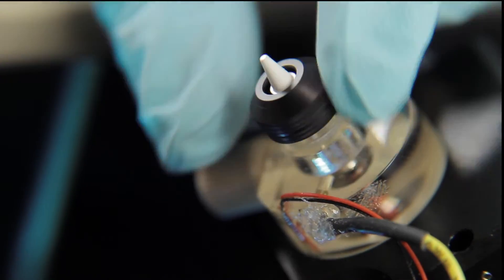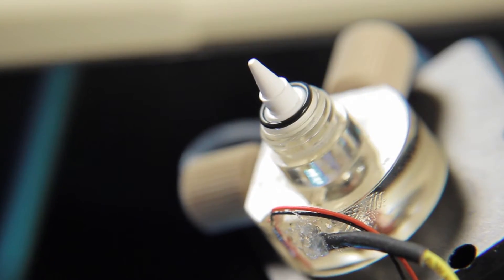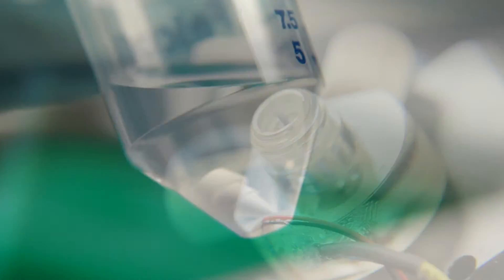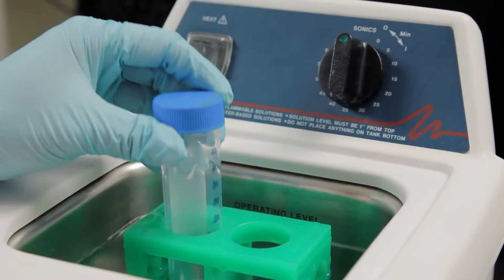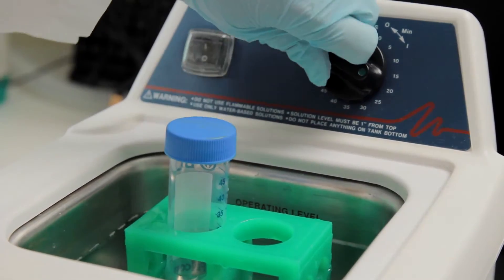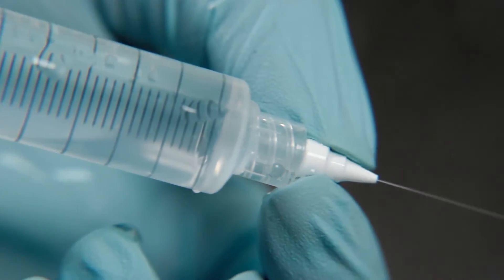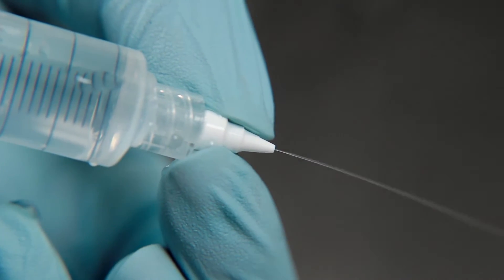Removing the nozzle tip takes only 15 seconds or less. Be green. With the S3E, there's no need to produce waste each day. The reusable nozzle tip is easily cleaned by sonication and a quick syringe wash.